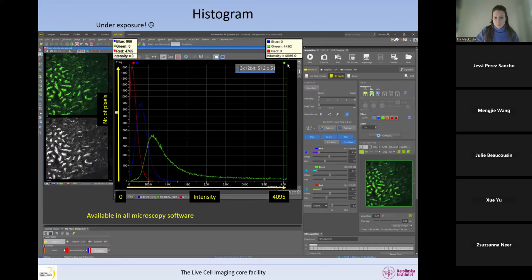We can see this big peak here and the little dot to tell us, ouch, please be careful. That is telling us that we have a lot of pixels at the intensity 4095, and this is a lot of pixels in the green channel, but we have nothing saturated in the blue and the red channel. So in the green channel, we have saturation. This is no good. What we see in here is that the peaks, so in the green, in the red and the blue image, most of the pixels are in a really dim range of the dynamic range that we have. So they are very much on the left side. Whereas on the green image, it's a lot more shifted towards the right, but we're saturated. So we can read this that way.